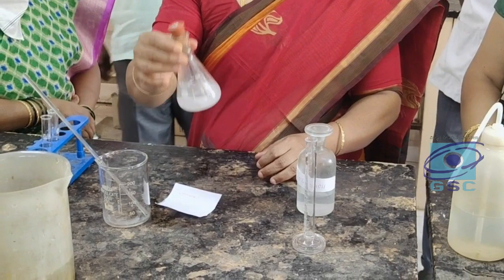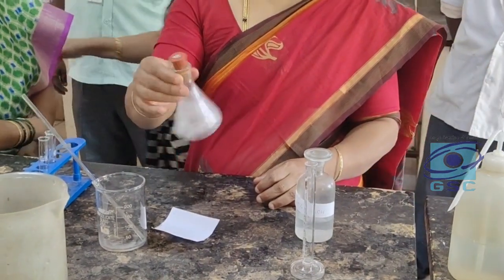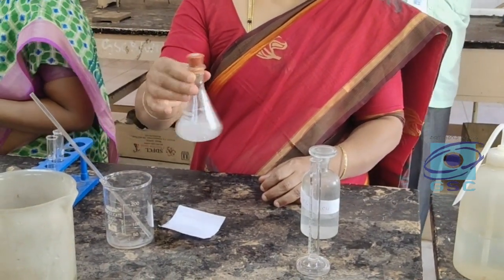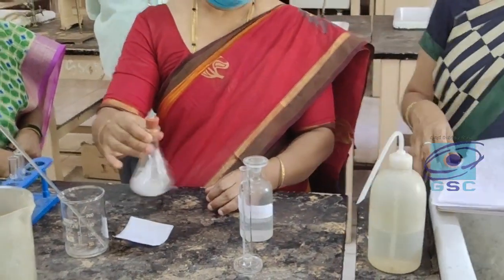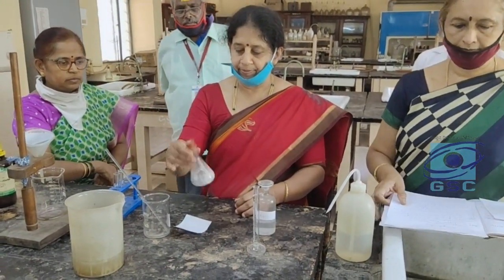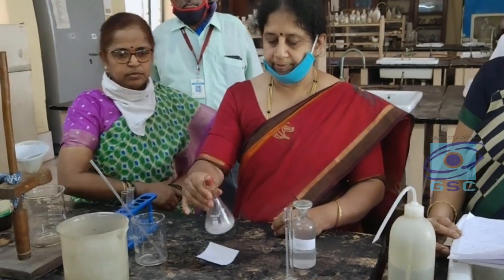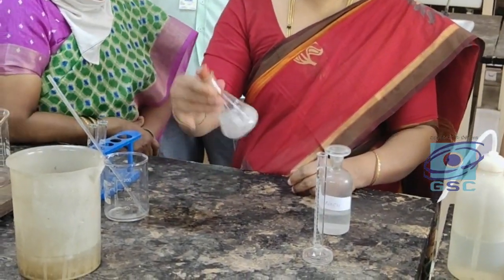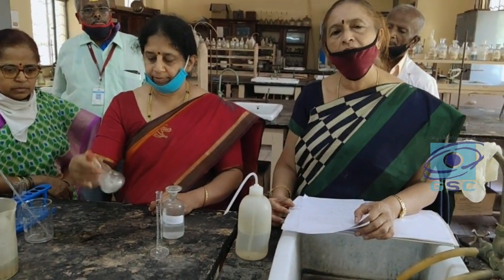Take care: 1.5 ml of benzoyl chloride is very irritating to the eyes. You have to wear safety glasses and also lab coats while preparing any preparation in the organic laboratory. Shake thoroughly and continuously. It is a simple one-step procedure, very easy to prepare in the lab.